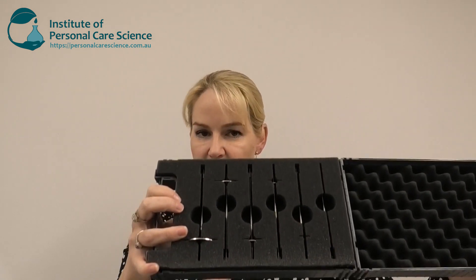Now that we've talked about the different types of spindles, how do you know which spindle to use? Here is a set of the disc spindles — you can see they are all different sizes. I will use a different size spindle for different viscosities of products. And so too with my T-spindles: I have a whole range of different sizes, and I'll show you this little kit as well.